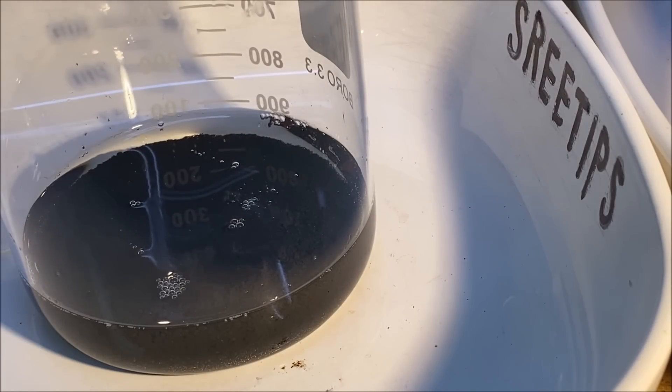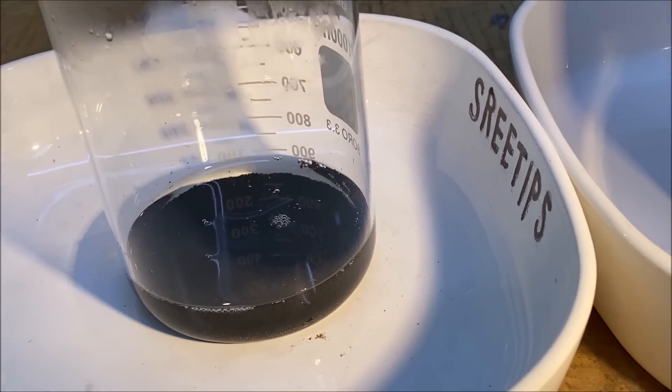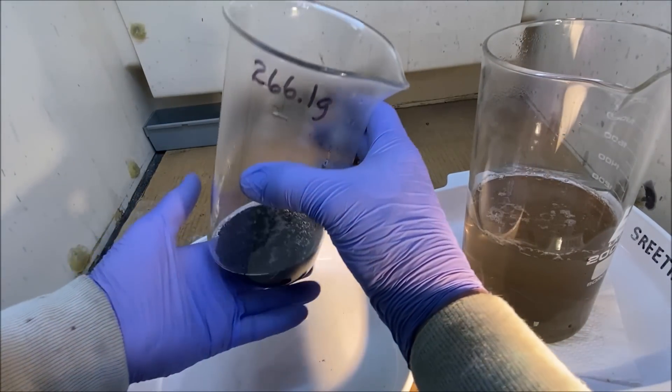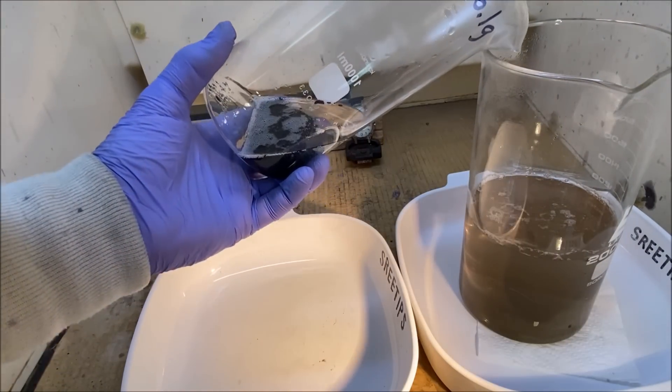I don't want to let it sit in this hydrochloric acid for too long or it'll start to redissolve. So I'm going to get rid of this charge of hydrochloric acid.